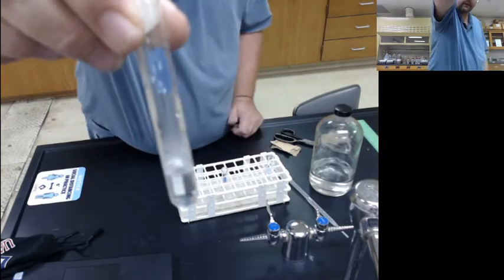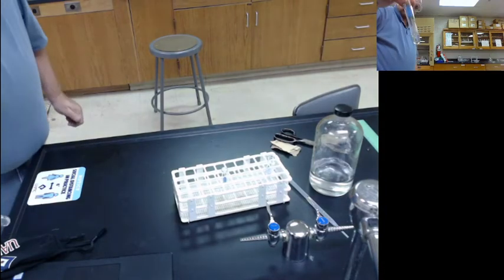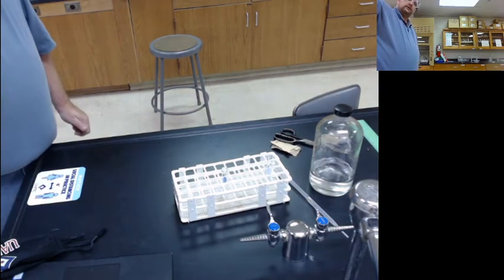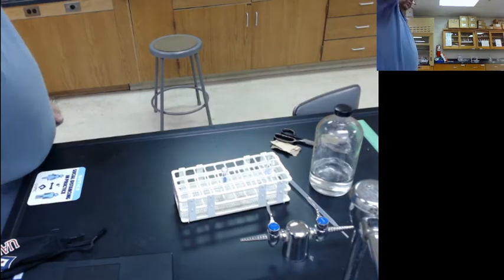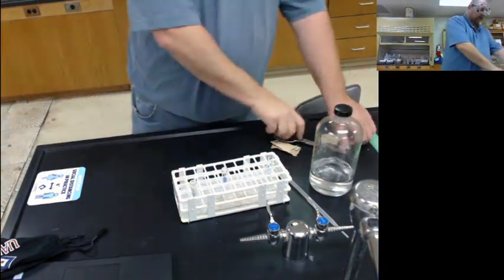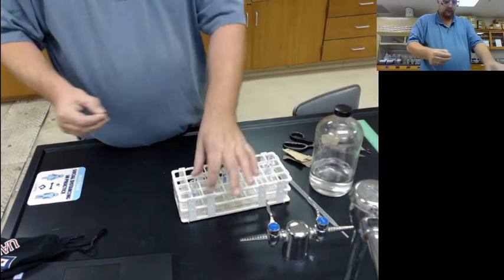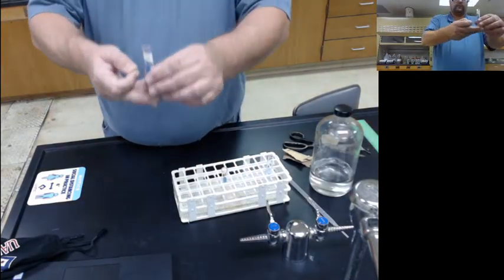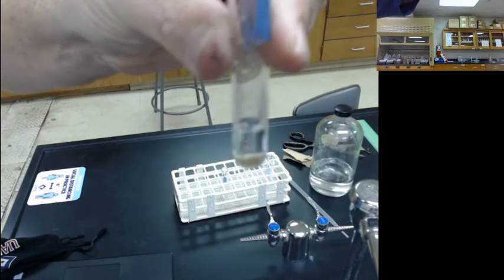And we're looking for signs of a reaction. And if I get my blueness out of the way, we might be able to see. And, oh man, the reaction actually happened too fast for us. We saw a bunch of bubbles. You probably heard the bubbles. And you'll actually notice I completely dissolved the magnesium. It went away. So if I cut off just a little tiny strip more, I'll get it to react a little more here. Maybe we can see it better. Maybe if I had something white, it would be easier to see. So I'll add this in here.